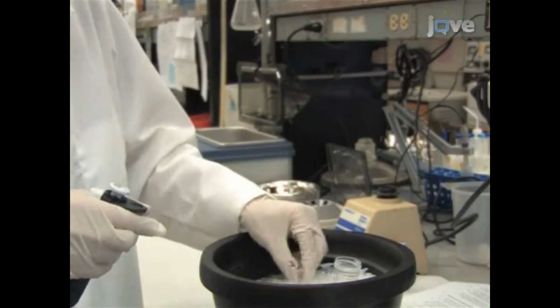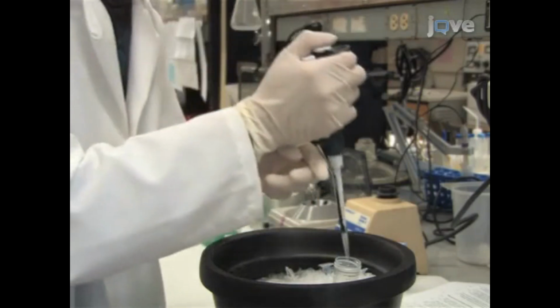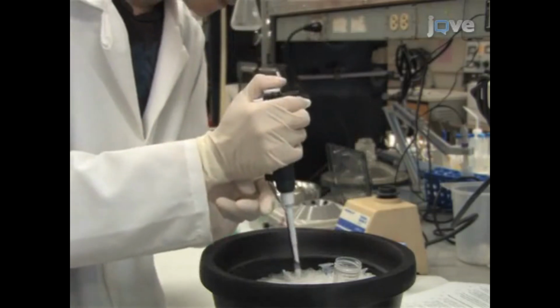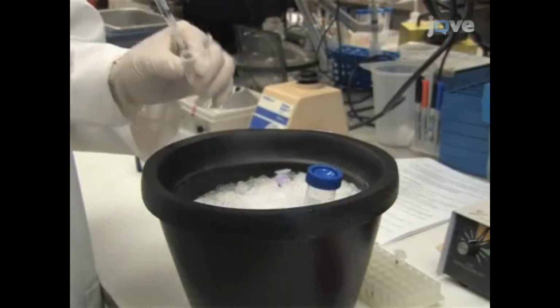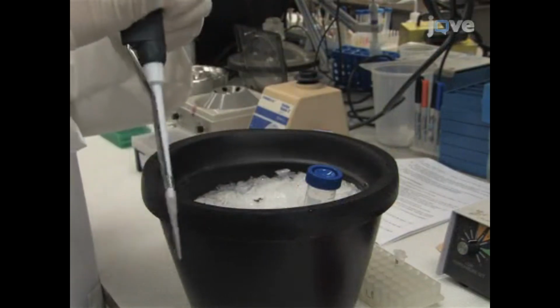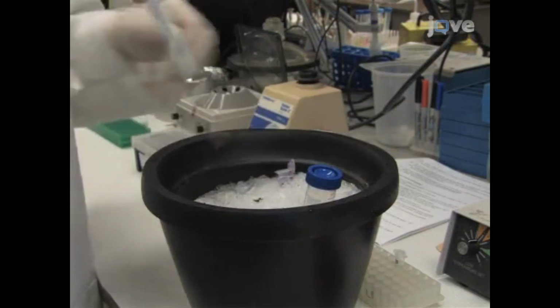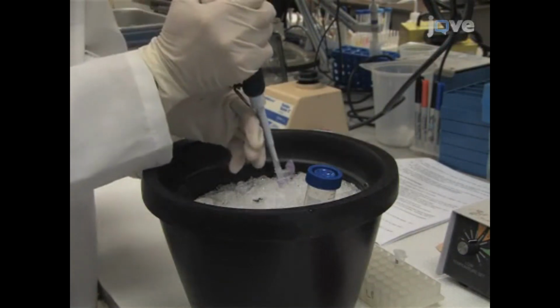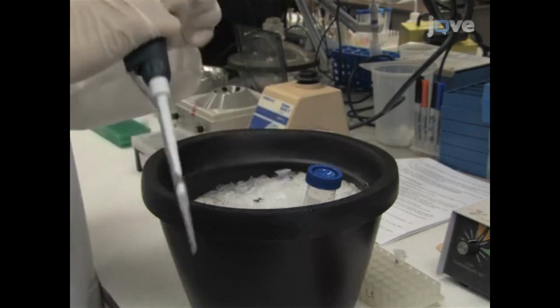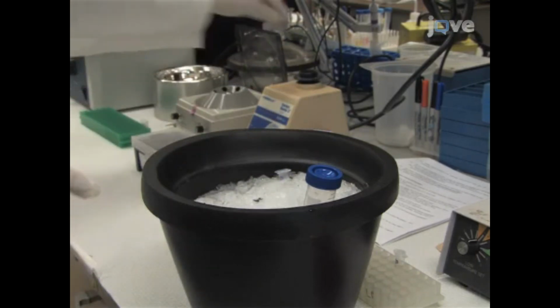Quench the hydrogen-deuterium reaction with 180 microliters of ice-cold 0.1% TFA at pH 2.2. Now, distribute 100 microliter aliquots of hydrogen-deuterium Pak2 to each 30 microliters of activated pepsin-conjugated agarose beads. Incubate this pepsin digestion on ice for 5 minutes, vortexing every 30 seconds.